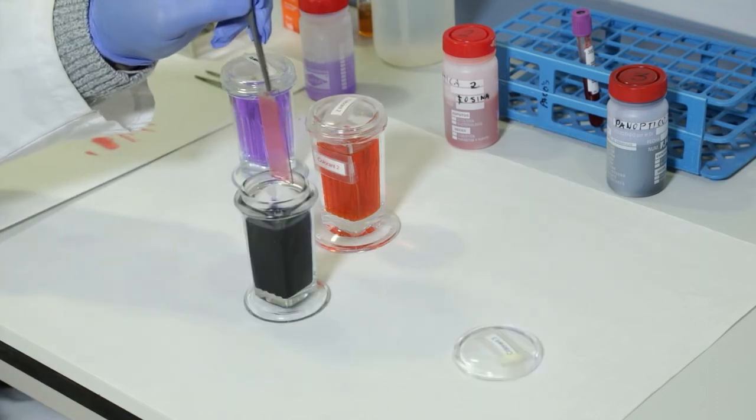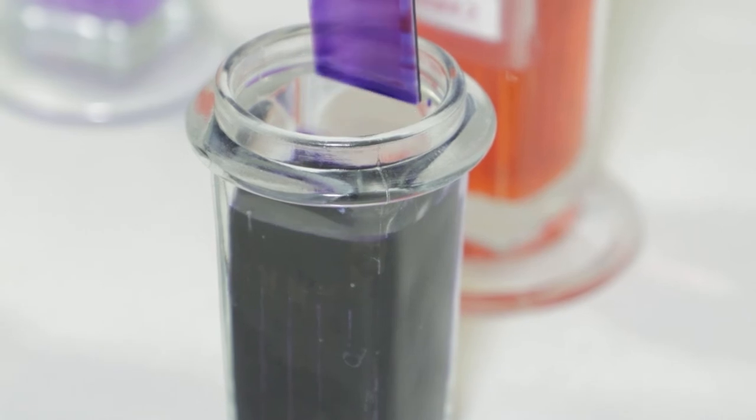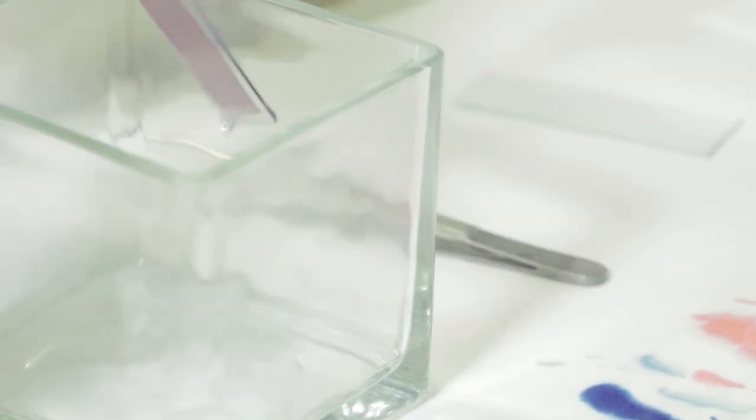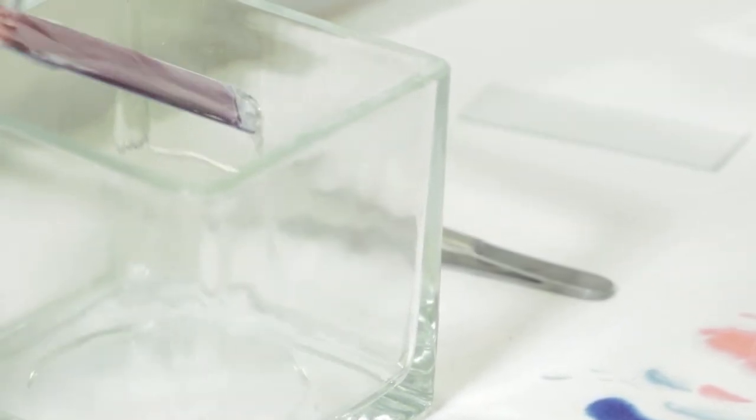Third, repeat the same operation on reagent 3, which is a basic type of dye such as methylene blue. Fourth, wash with distilled water and leave to dry.